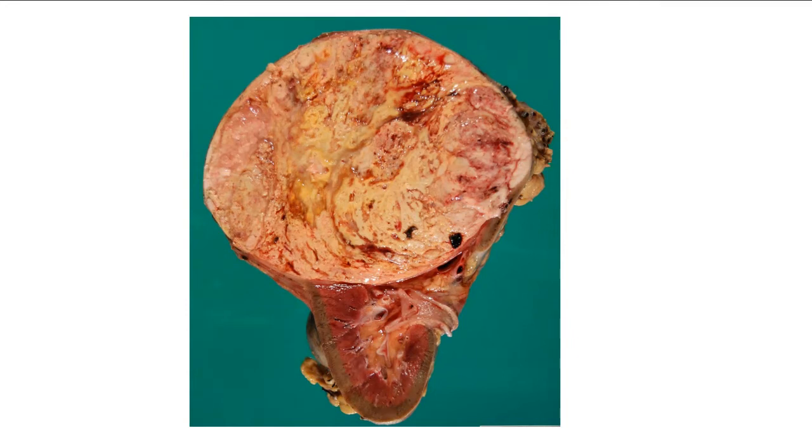Let me look at the tumor. So if we have other tissues submitted, Daniela, yes, we can look to see if there is tumor present in those other tissues. So which other tissues am I talking about? So we're already talking about an invasive tumor, Daniela, so it would already have infiltrated the basement membrane. All right, so Kyle, we could have the tumor extending directly to adrenal gland. Yes, that could happen. So they could have sent adrenal gland, and they sometimes do, with a nephrectomy specimen.